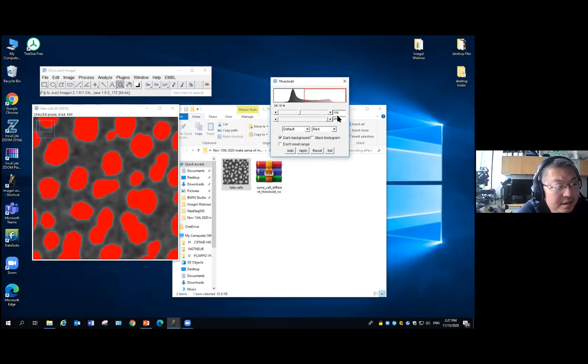And how do you know it's the best? There's no rule on it. It's a pure personal choice. If I say I think 110 here is the best threshold, and you may feel 105 is the best, I do not agree with you. I think 110 is the best. You ask me why. There's no why. I like it. That's just my answer. People always think you should have some objective standard to decide. In this case, it's actually not. It's just the user, the scientist doing this, who needs to make a choice. You need to decide which threshold is the best. I think 110 is the best. Why? Because I can show you this is a very nice representation of all the cells. Okay?